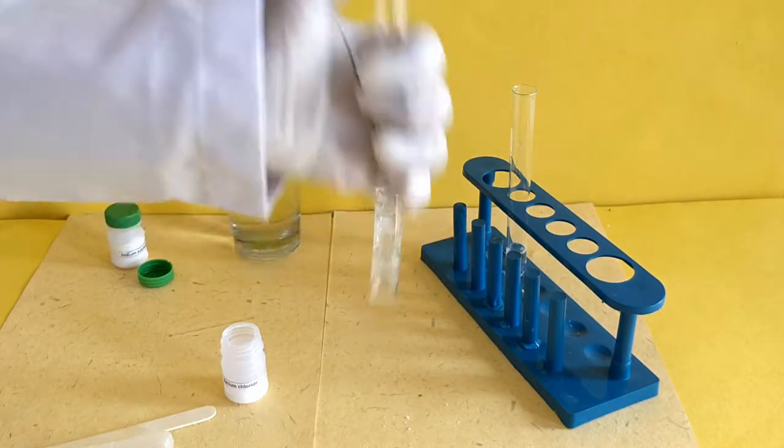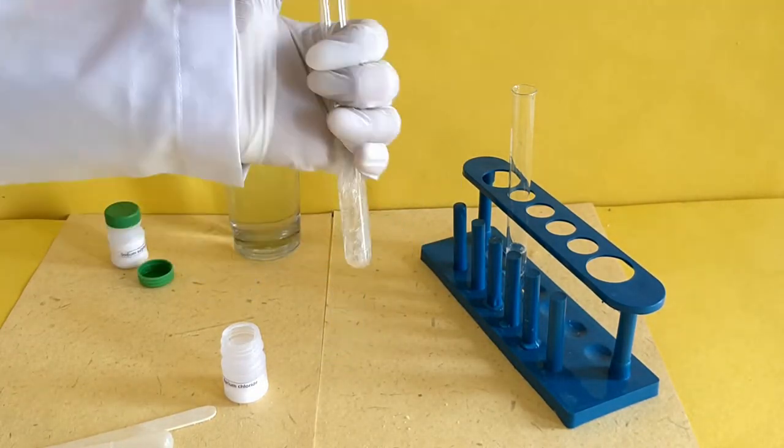Similarly, prepare an aqueous solution of sodium sulphate in a separate test tube.